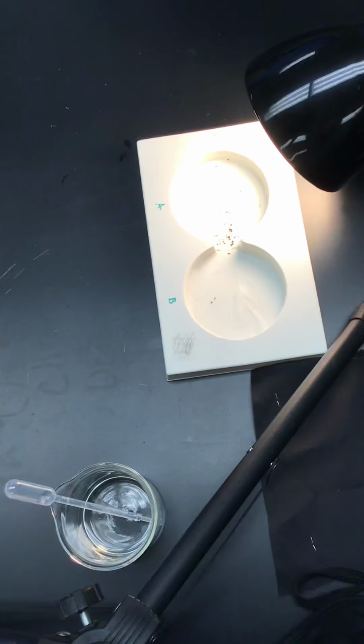For this lab, we created 2 different experiments to test pillbug's senses and whether or not it would recognize its surroundings. In the first experiment, we tested the pillbug's ability to differentiate between a moist and a dry environment. Because pillbugs live in humid areas underneath rocks and logs and among leaves and rubble piles, we expected the pillbugs to gravitate toward the moist environment. So for the moist versus dry lab, we tested their sense of touch.